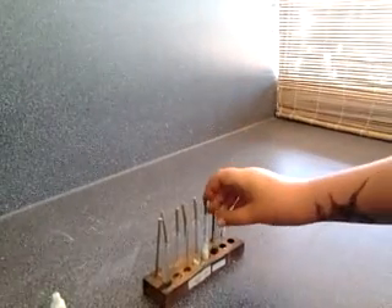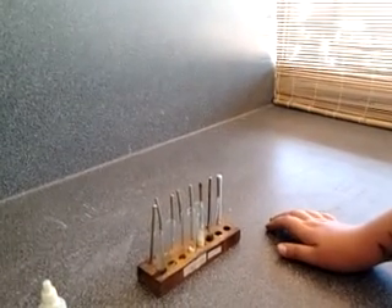So that's how to test food using Benedict's solution. And this is how to do it.